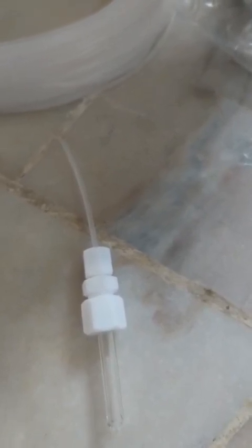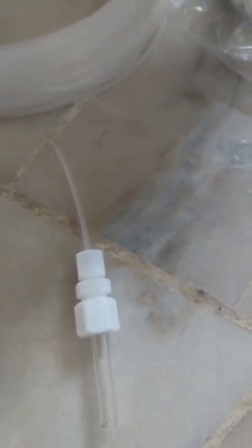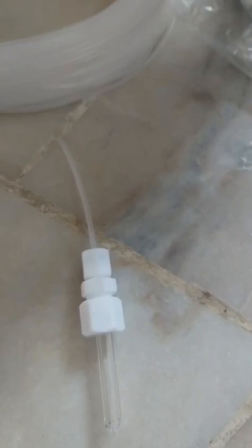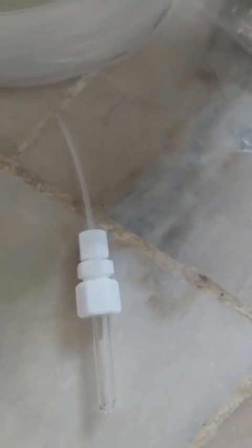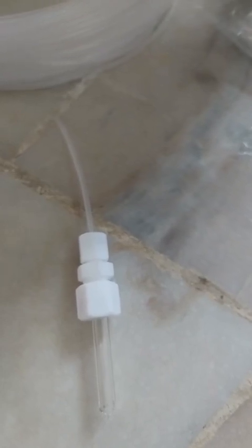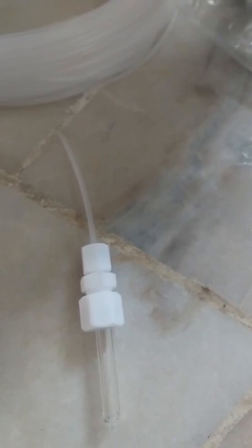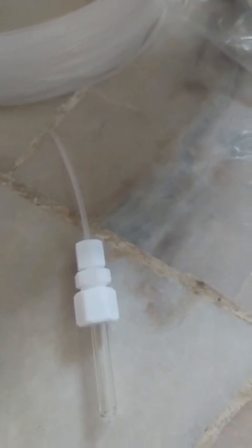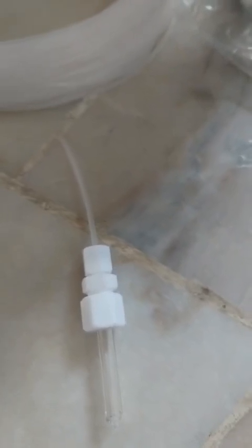For example, if you would like the pressure inside to be controlled at 0.1 megapascal, you can choose to give the pressure source at about 0.12 megapascal, but also not too high. Too high is not easy for you to control. Just enough for use is enough.